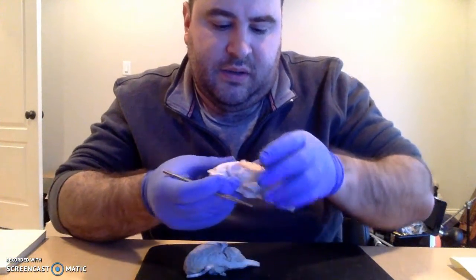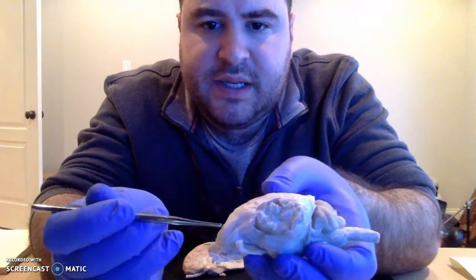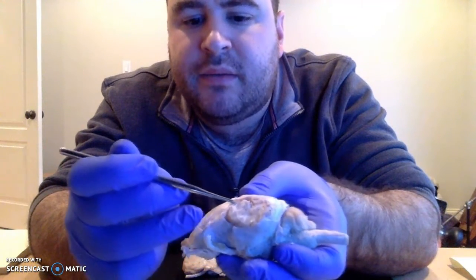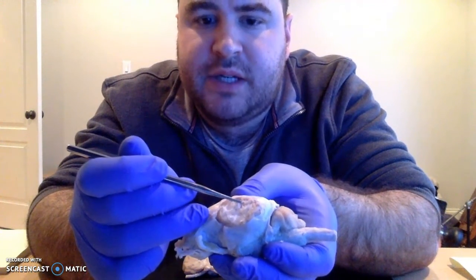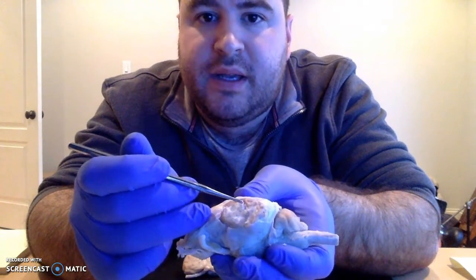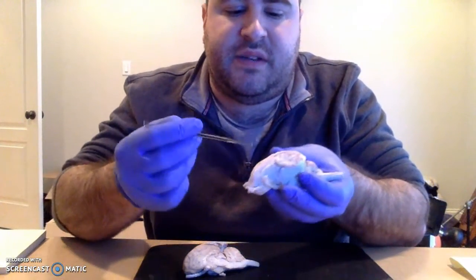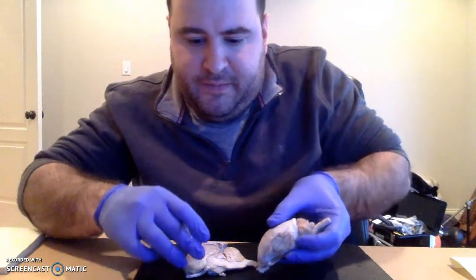Okay, what else do we have? I kind of took a little slice off the side here so I could better show you guys the distinction between the gray matter and the white matter, and what causes that distinction is the difference in myelination. So gray matter contains unmyelinated neurons. White matter is very myelinated. The cortex actually covers the entire surface of the cerebrum, and that's all gray matter. And deep to that, we get more white matter.